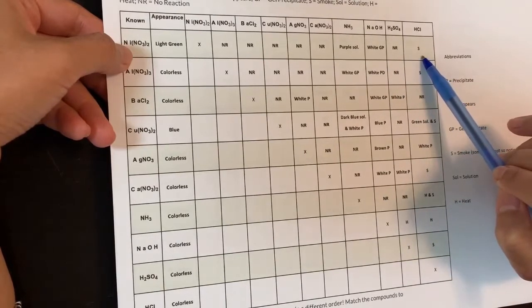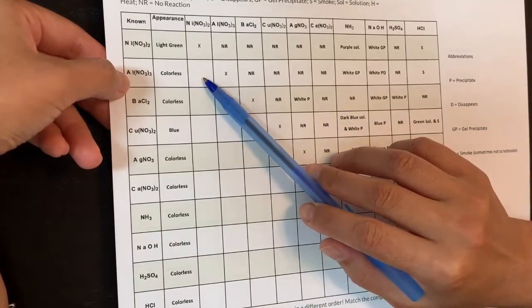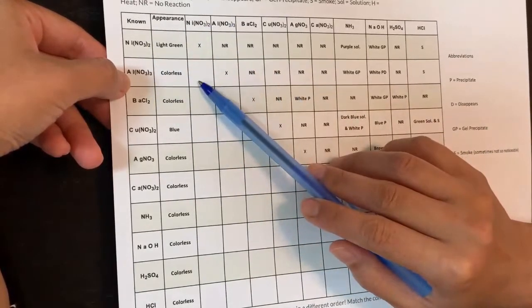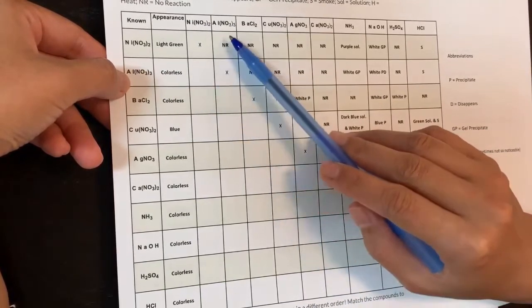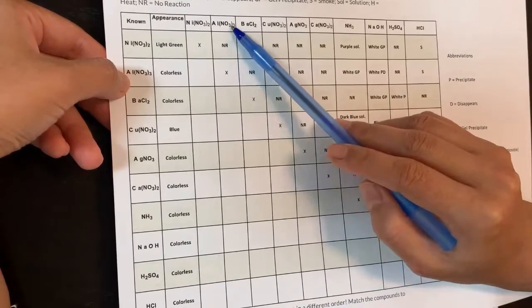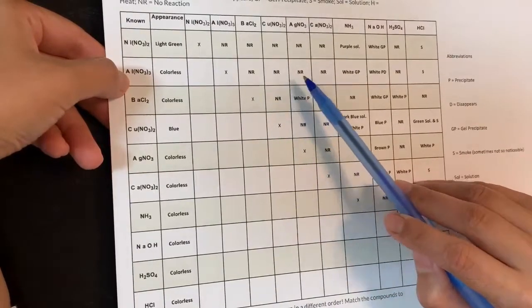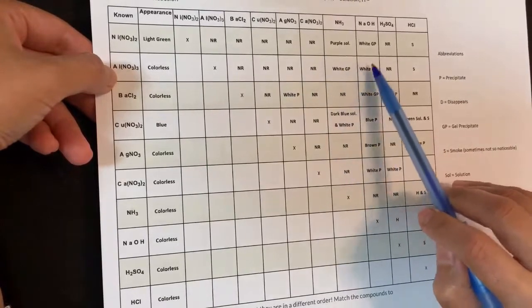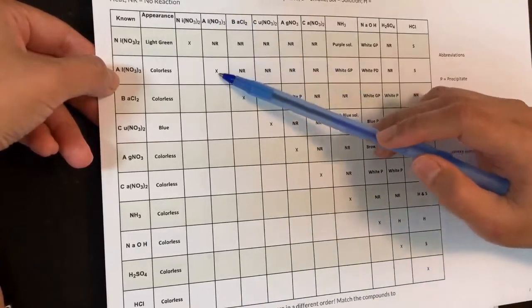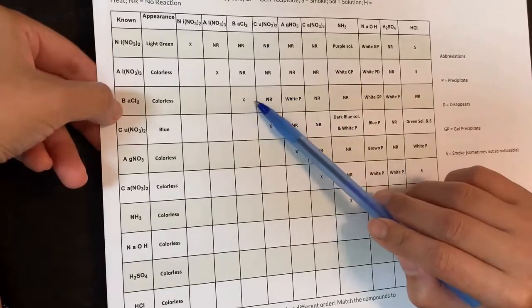If you notice an empty box — for example, nickel and aluminum — that's because this is a mirror image on the other side of the table. Nickel and aluminum is the same as aluminum and nickel, so we leave that box empty and read it from up above. The cool way to read the table is to go in an L-shape: go down, hit the X, then turn right. For aluminum: L-down, hit the X, turn right. Same for barium.